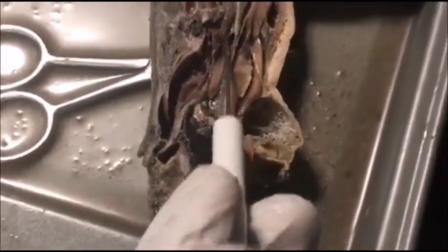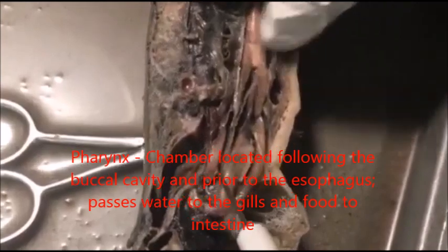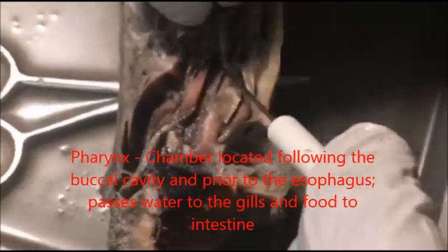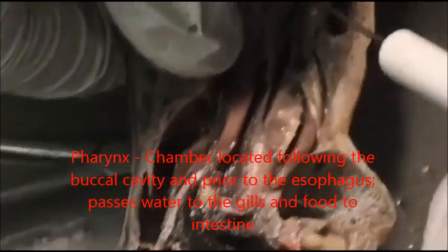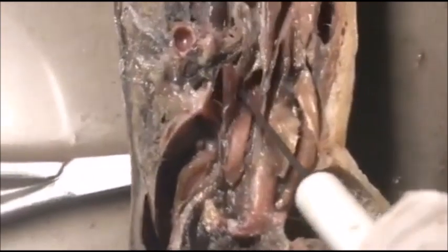So if it goes in from his mouth and into the pharynx — there's the pharynx right here. The pharynx allows the blood or body fluid to enter further into the digestive system.